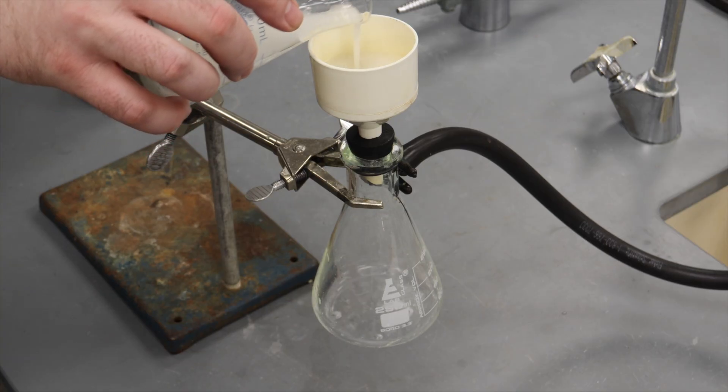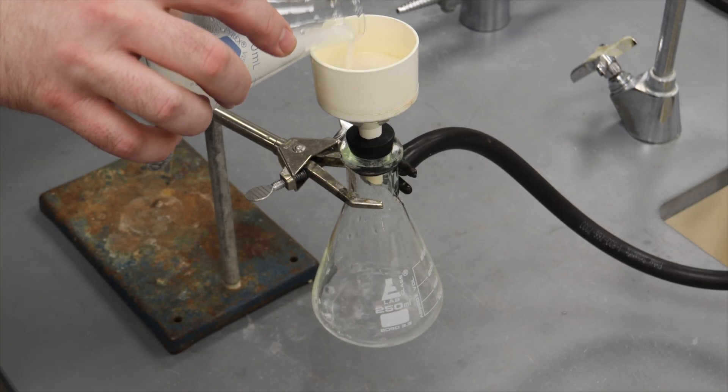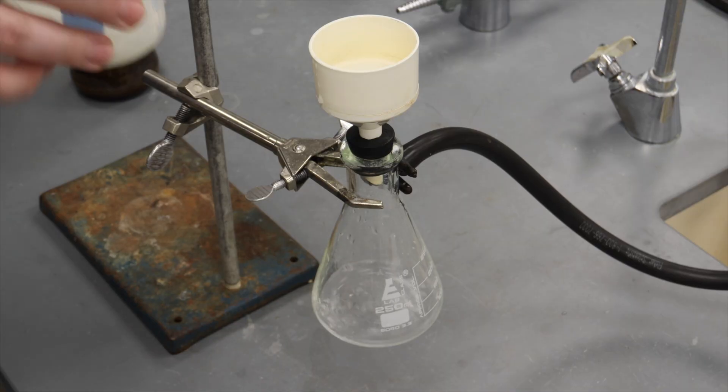Unlike gravity filtration, vacuum filtration takes advantage of a vacuum to draw the liquid through a funnel.